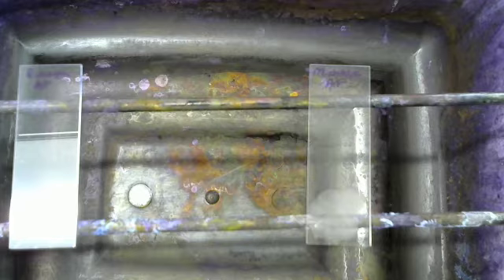Now, I'm assuming that you've already watched smear prep, simple staining, and gram staining. It's important because each of these stains builds off of the last. As we saw with simple staining, we took a heat-fixed smear prep and added some stain to look at the bacteria's morphology. For gram staining, we took a smear prep, a simple stain, and then added a mordant, Gram's iodine, plus we did something to it. So it's stain plus mordant plus something that gets you a test.